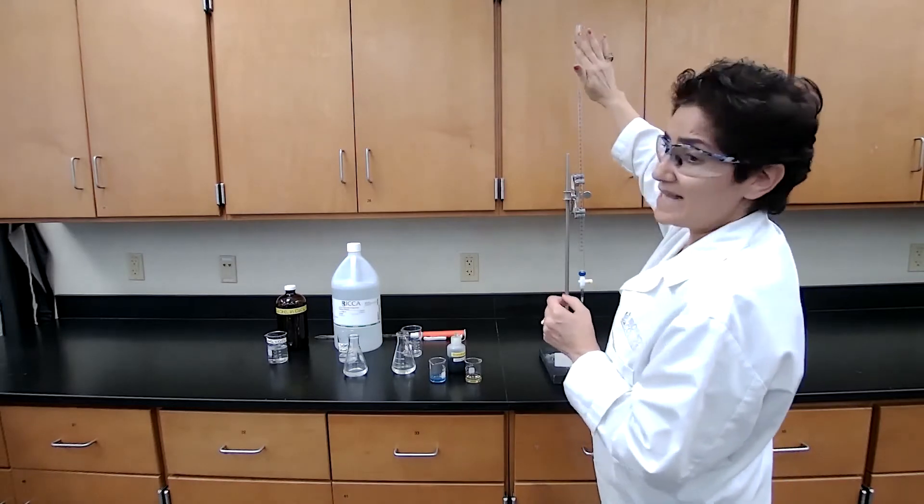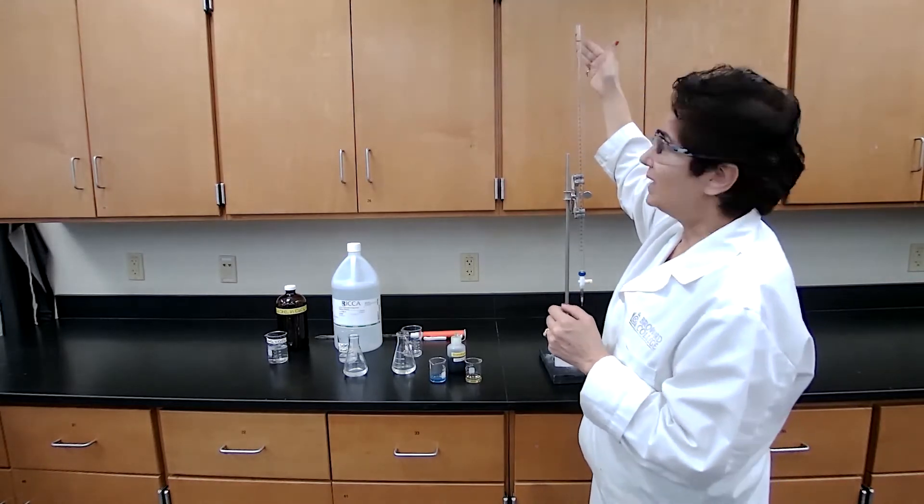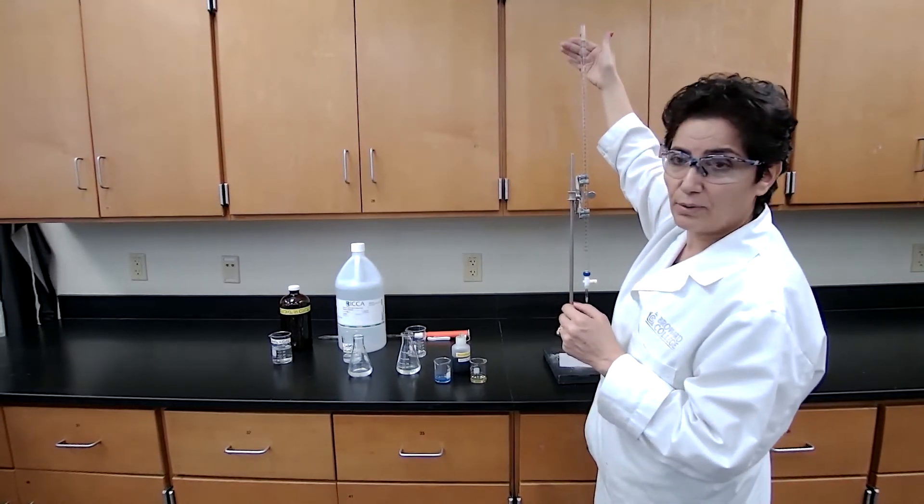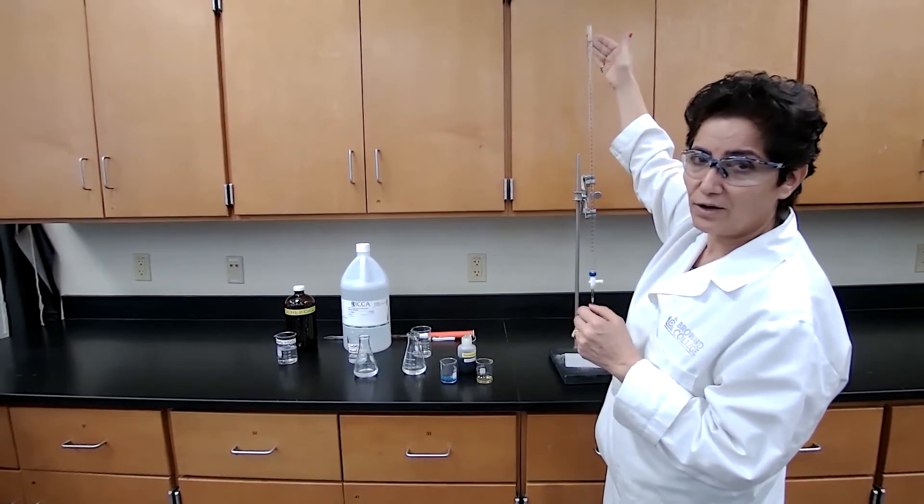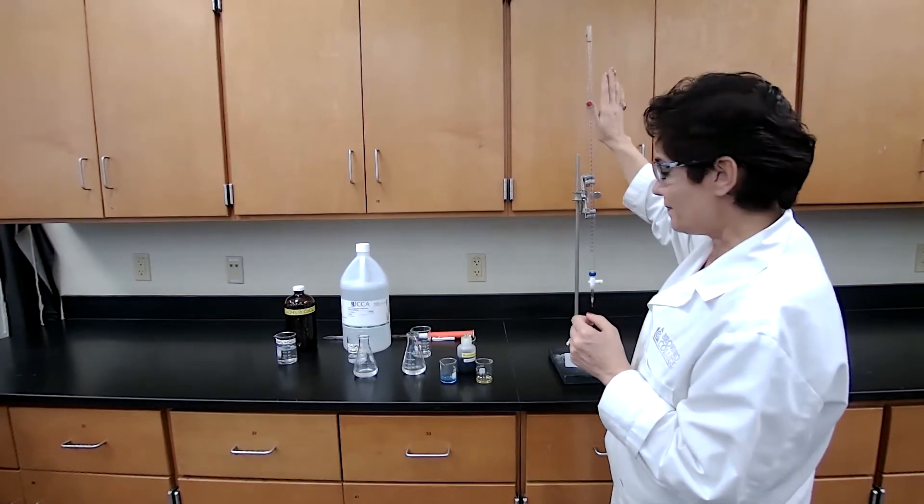Which in this case is actually zero. And you can record this number as the initial burette reading for the HCl.